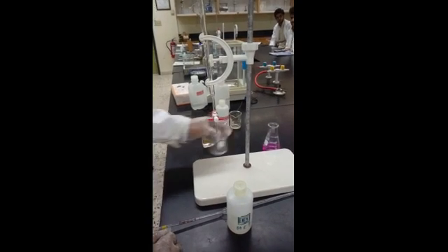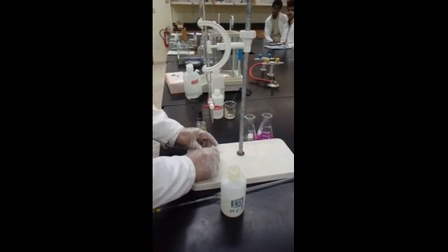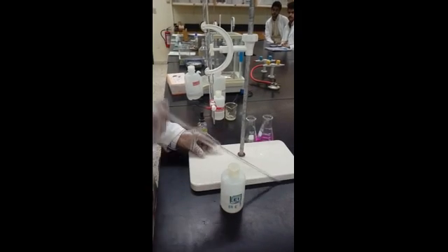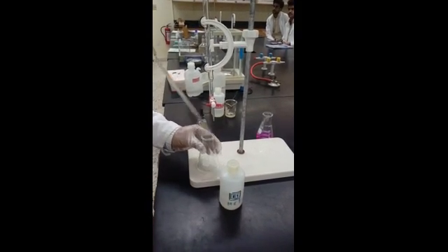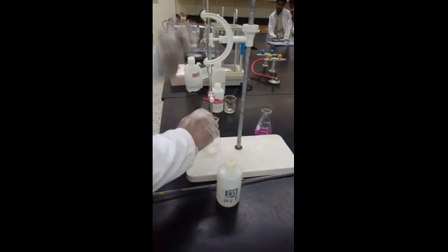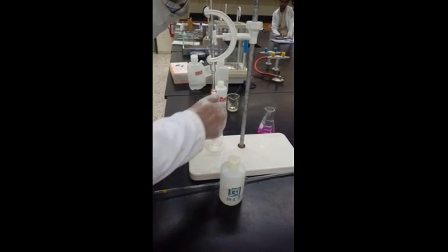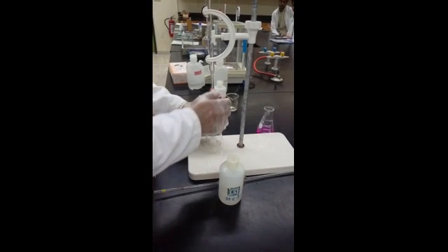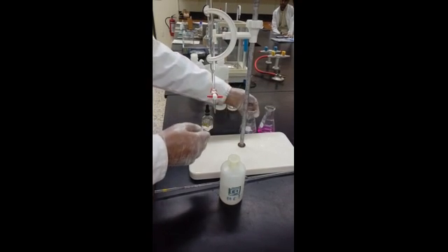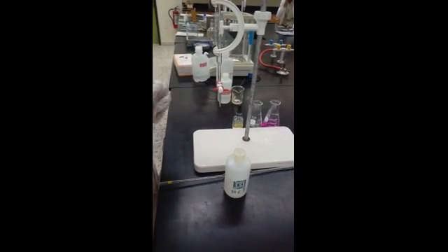And then when we finish, keep it there. Then you will bring another flask. And then you will do another 20 milliliter. You take another 20 milliliter inside and again drop indicator, 3 drops. Again start the titration from that place and go down. When you get the color change, stop. Same as last. And you have done it. So how many titrations have you done? 3. Then we go for calculation.